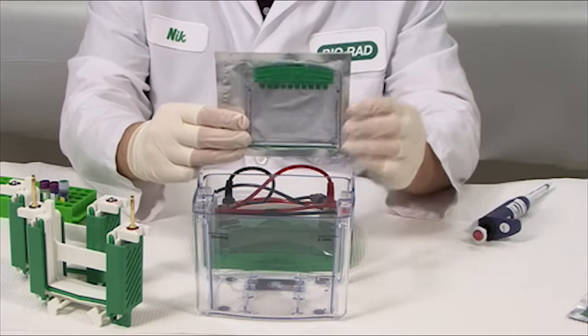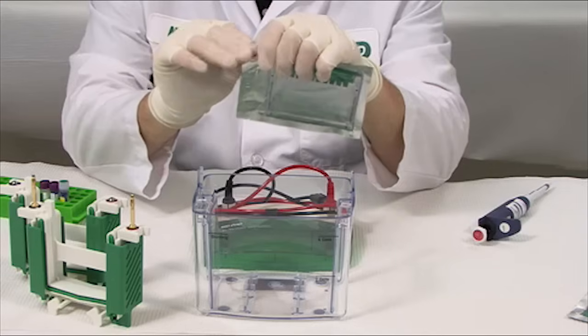To open the TGX gel package, grasp the pouch firmly and begin tearing at one of the notches.